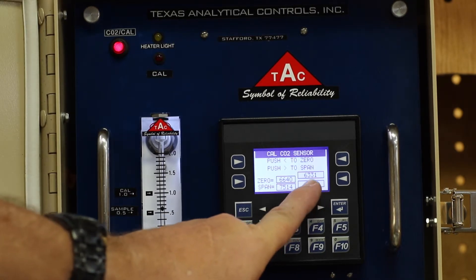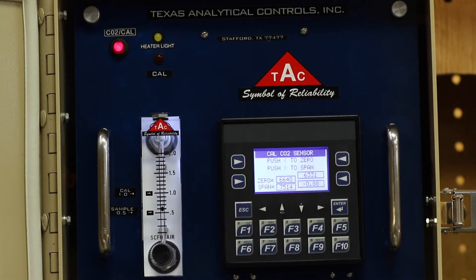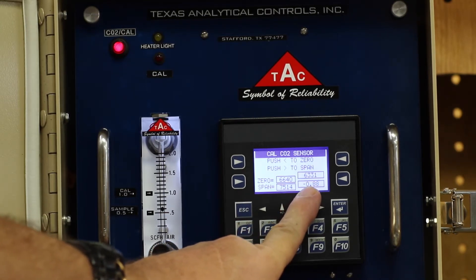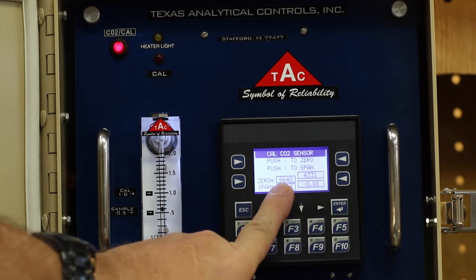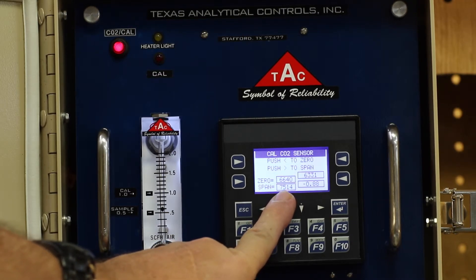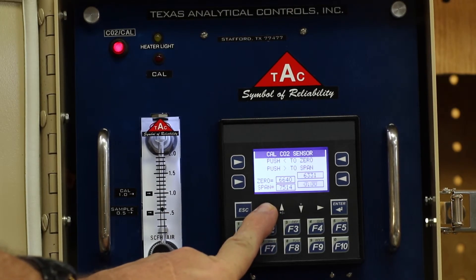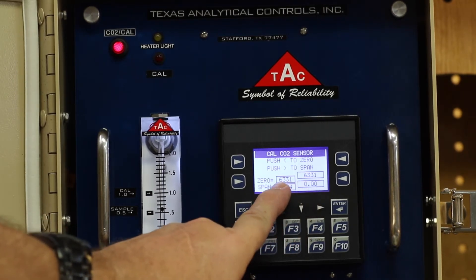You will notice that the counts are dropping and this could take approximately 3 minutes. This box shows the current counts; below is the box with the CO2 readings in percent. There is also a box where zero counts are stored and a box where span counts are stored. Once the counts are stable, hit the left arrow key and you will note that the counts have now moved to the zero box.